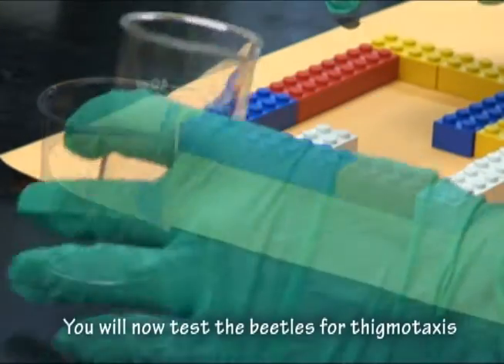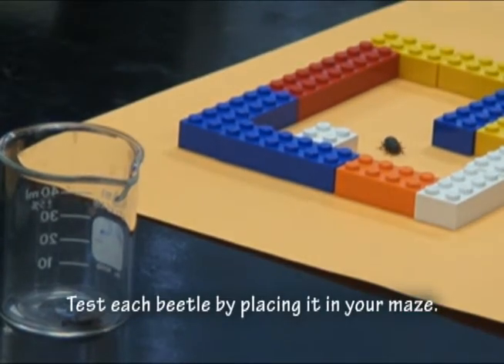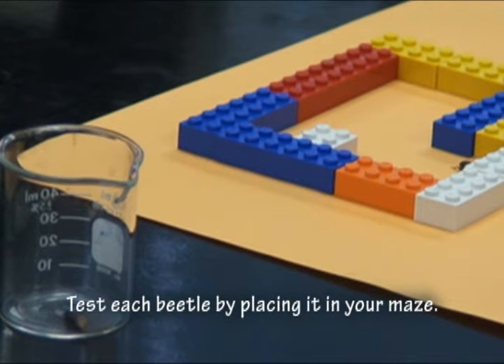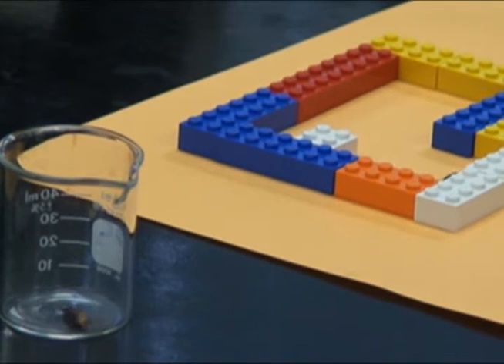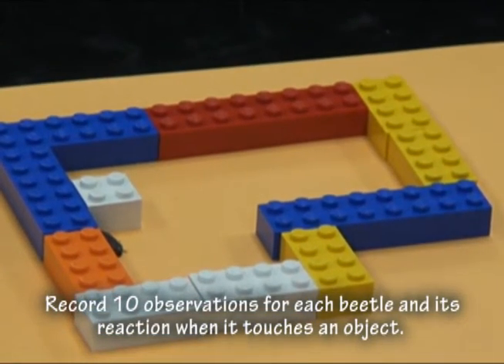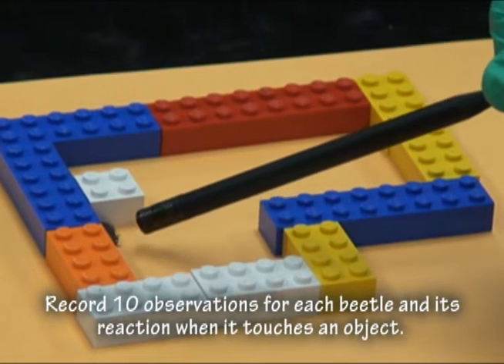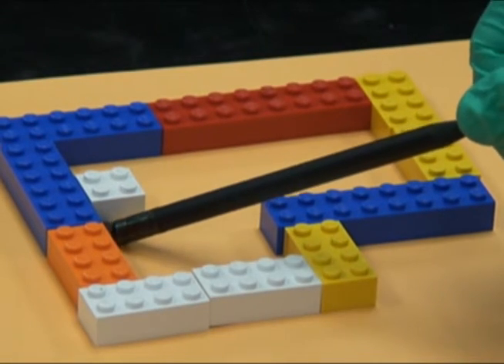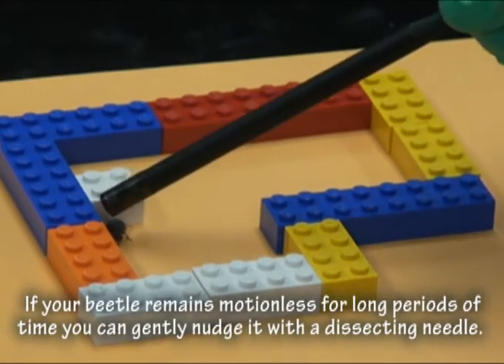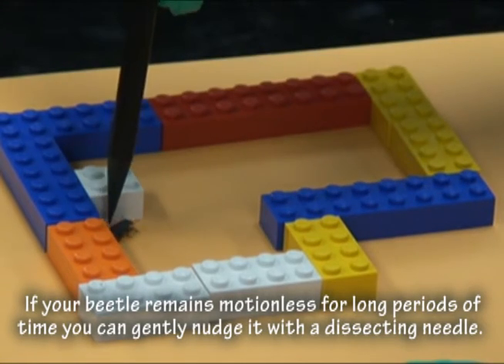You will now test the beetles for Thigmotaxis. Test each beetle by placing it in your maze. Record ten observations for each beetle and its reaction when it touches an object. If your beetle remains motionless for long periods of time, you can gently nudge it with the dissecting needle.